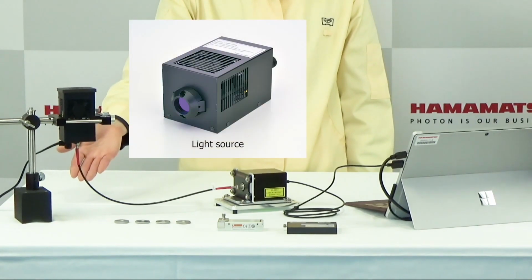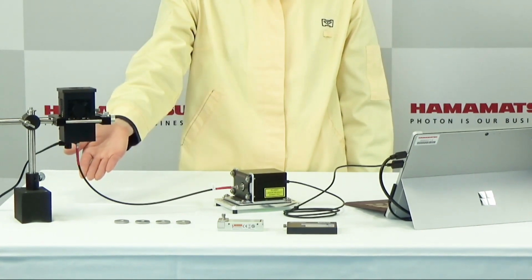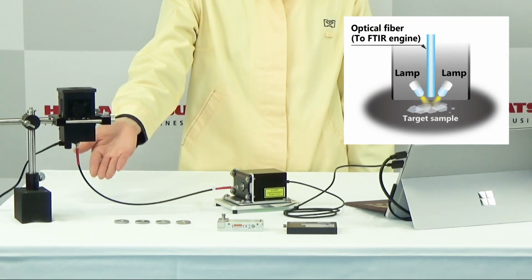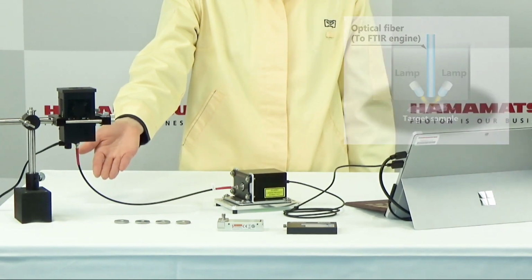Moving on to a light source, we're using a source designed to optimize diffuse reflection measurements. Typically, diffuse reflection signals are low in intensity. This light source was designed to enhance the reflected signal through the internal structures seen in the diagram.